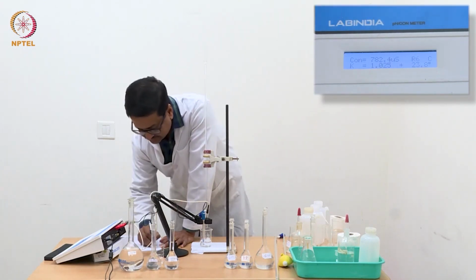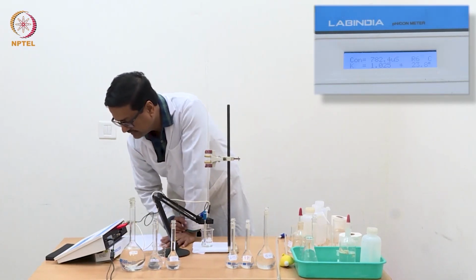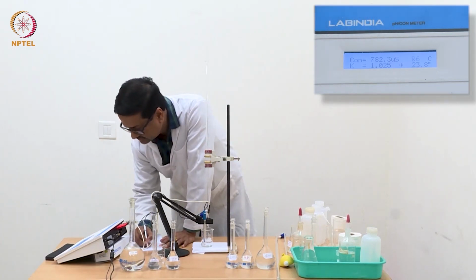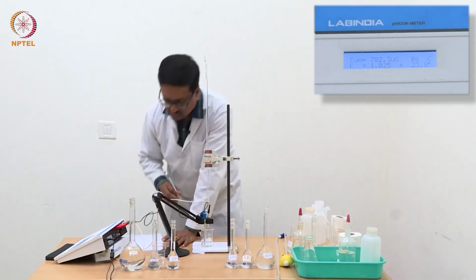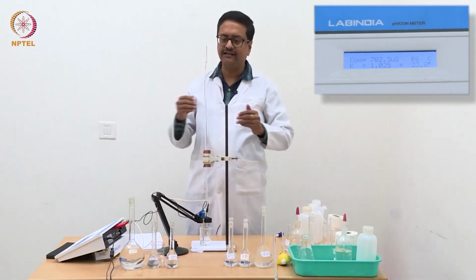Remember that here the reading is already in microsiemens. So we write down 782.3 microsiemens. That is my starting point.